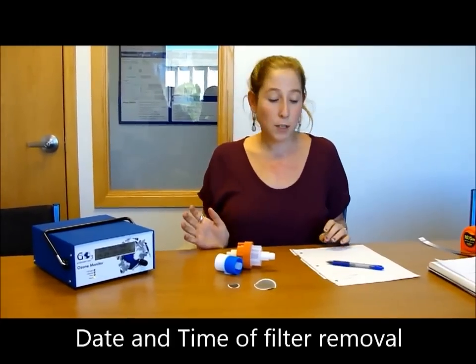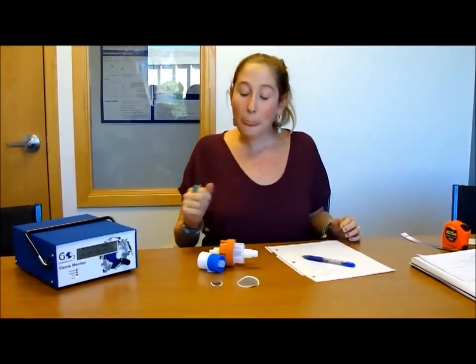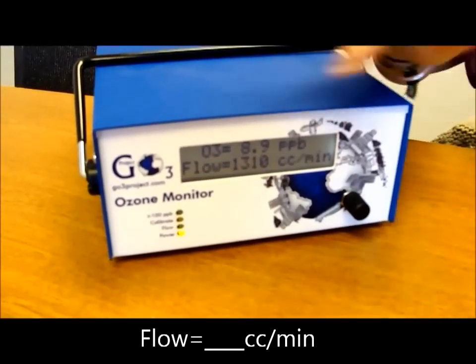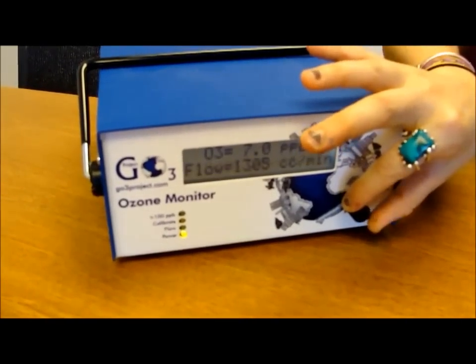Now the next step you're going to do is record the measurements. So you're going to write down the date that you ended it, that you took the filter out, so maybe that's 2 weeks later, and the time that you took it out, and then we're going to take a couple more measurements. We're going to check the flow, and you simply do that by twisting the knob to the right, and on the screen the flow rate will be given right there, and you'll record that value.